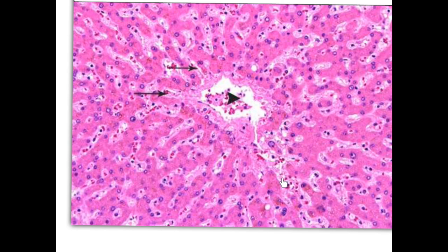Look at this one, it's a very nice blood sinusoid, and as it is opening in the central vein, it drains the blood finally to the central vein. So the blood sinusoids take blood from the branches of hepatic artery and branch of portal vein in the portal tract, and the blood passes through this blood sinusoid to supply the liver cells. And the waste will be collected again in the blood sinusoid to be drained into the central vein.